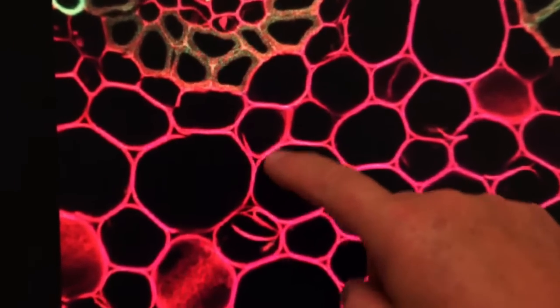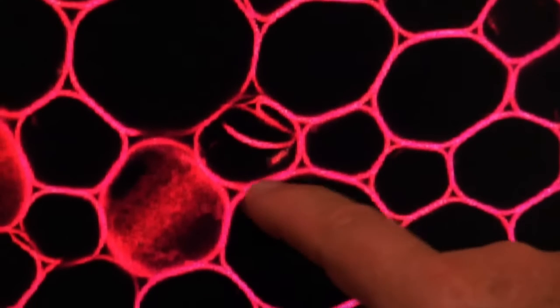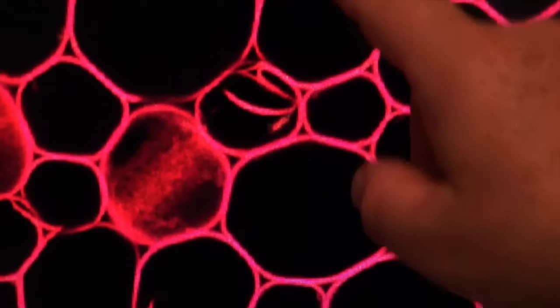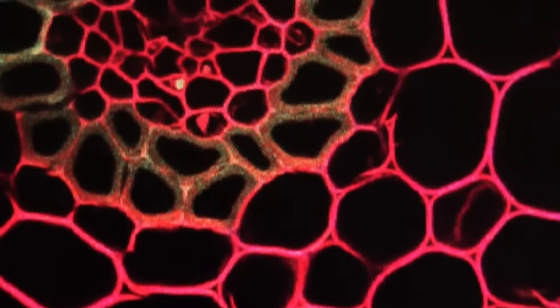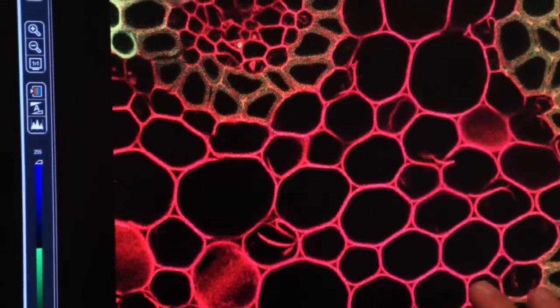This is a 512 by 512 image. And here we can see a lot of pixelation. So even though we did line averaging at 512 by 512, we can still see a lot of pixels. Now I want you to watch when I click on a 8K by 8K image that was taken previously, and you'll see the difference in the resolution.